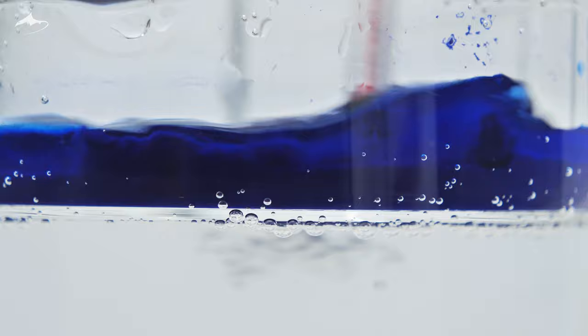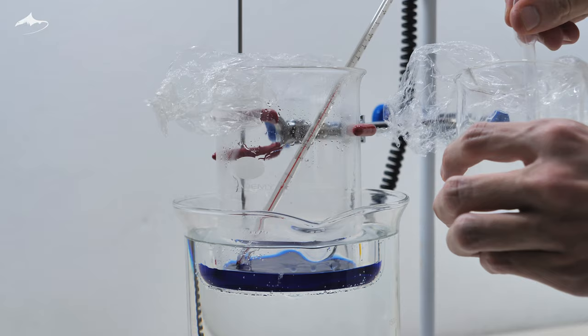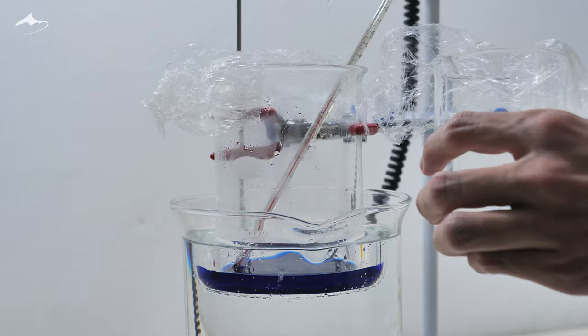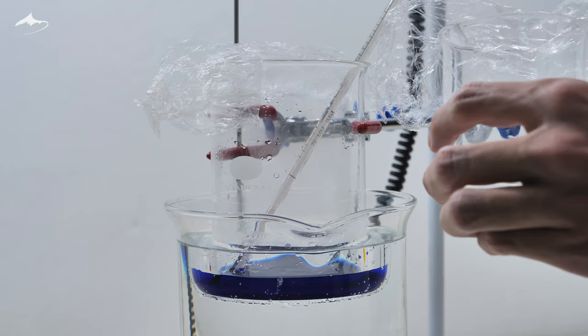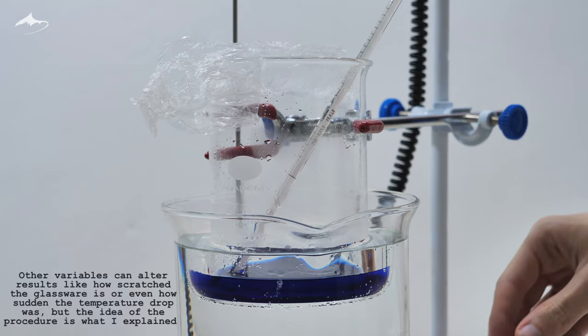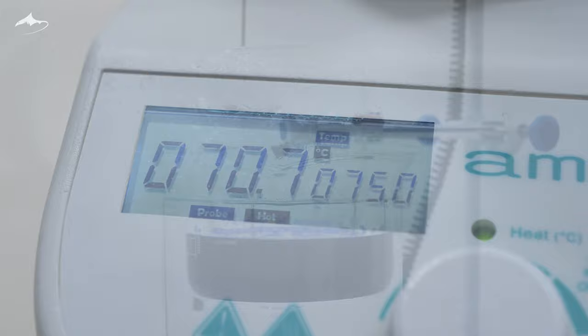As you can see there was a lot of salt yet to be dissolved so more solvent was needed. I kept adding it in small portions, waiting for the solution to reach the correct temperature between each addition. The reason I added the solvent slowly was to reach a saturated solution in hot conditions. That means that only the exact amount of solvent is added without the slightest excess, so as soon as the temperature drops, crystals begin to form.